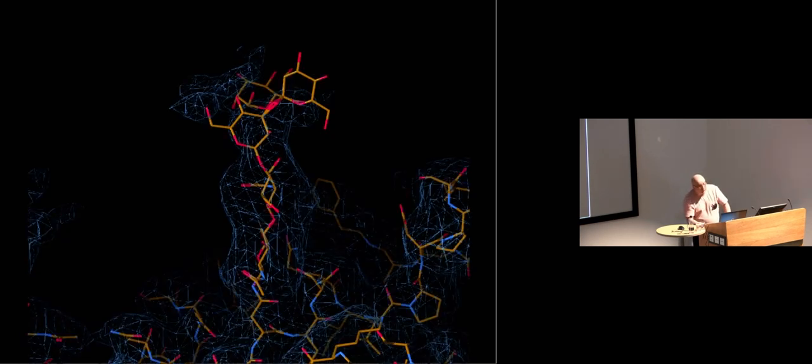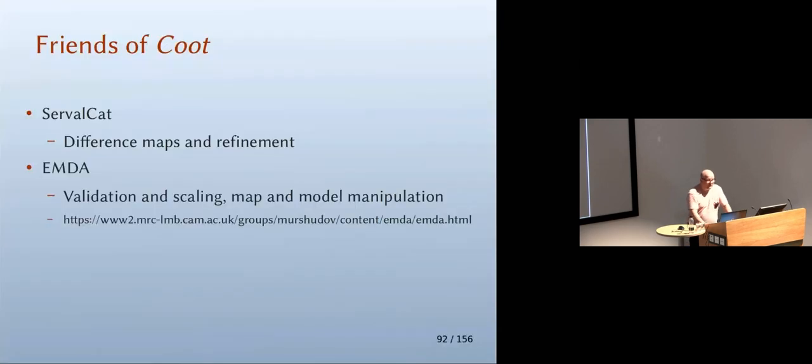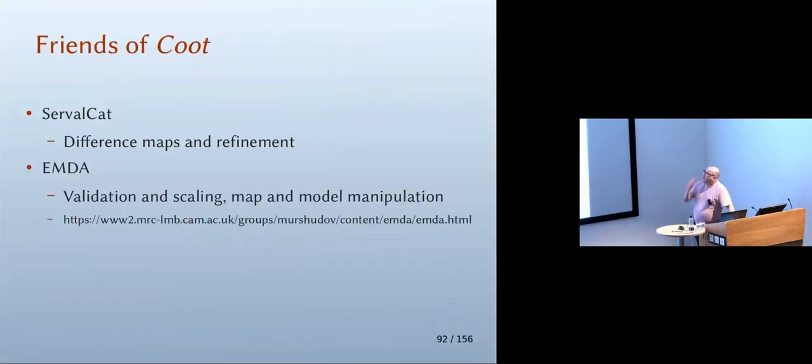Now, if we use Coot's model building tool for carbohydrates, we can turn something like that, where there's an extra atom down here. I don't know whether you can see it. It's both blue and red because the oxygen hasn't been removed. And over here, there's a missing alpha-1,6 link. The missing link, as Rob would call it. In about a minute, that can be rebuilt using Coot's rebuilder.